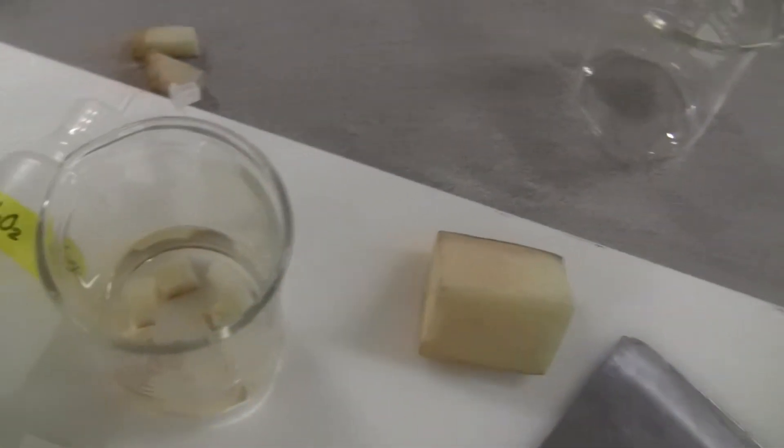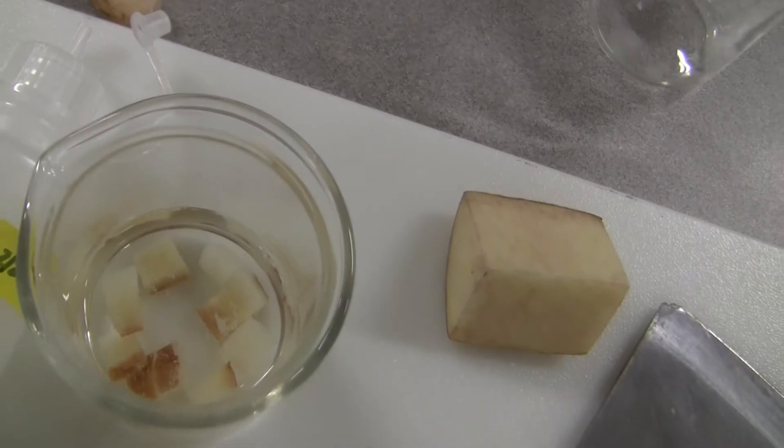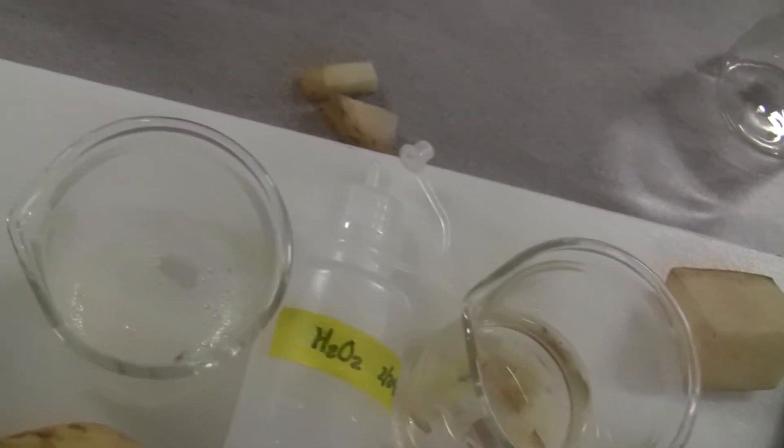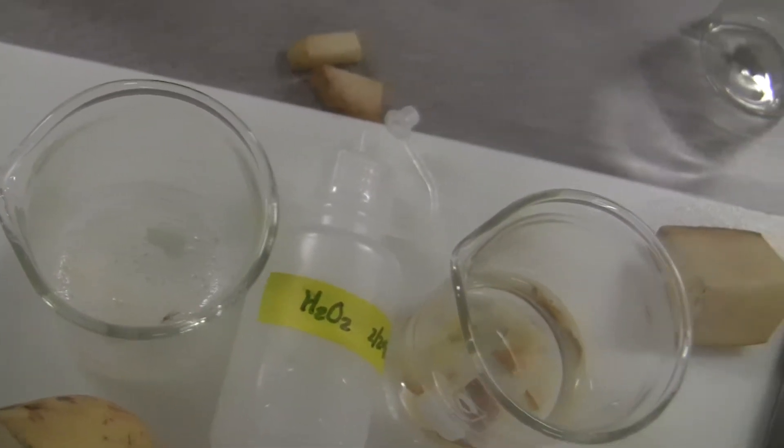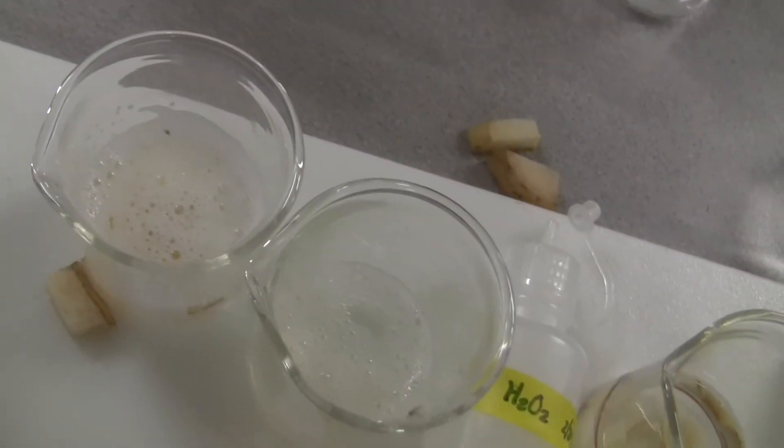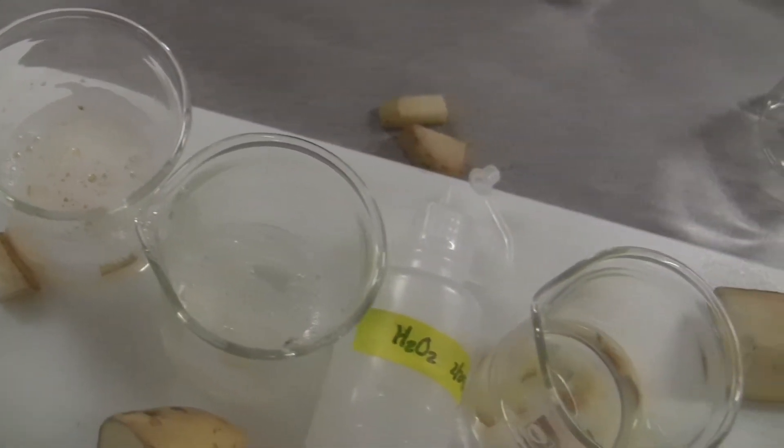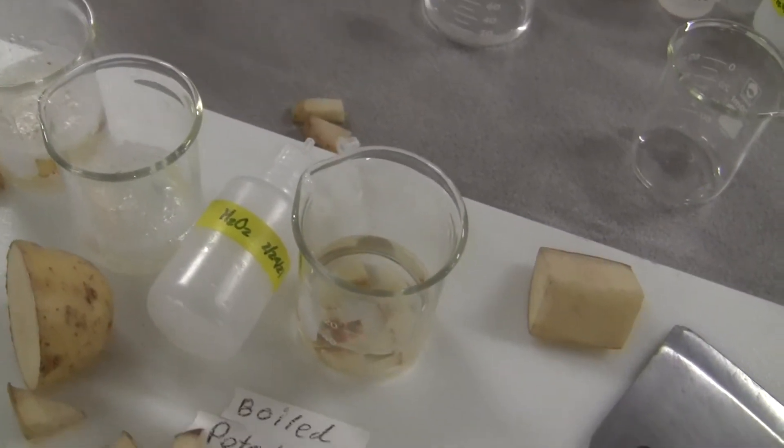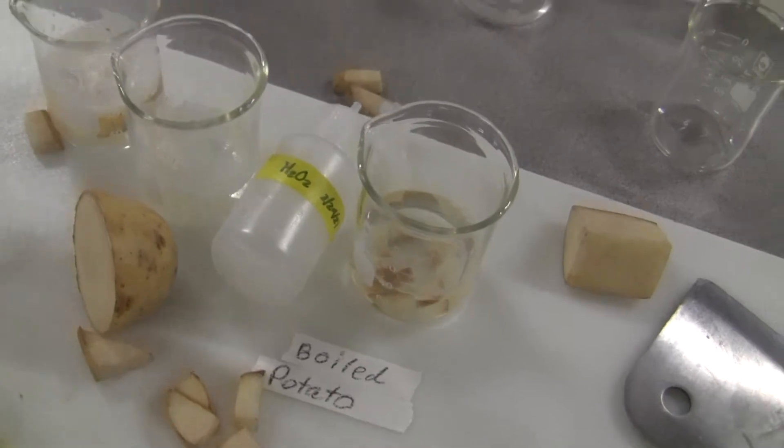And look. Of course, the boiled one does not have any bubbles. And look. The one that I did not boil, just like this one. These two ones, I did two of them. There is a lot of bubbles. So hydrogen peroxide causes bubbling when the enzymes are alive.